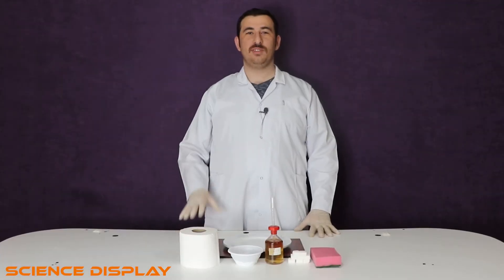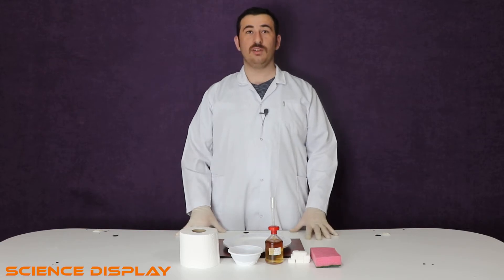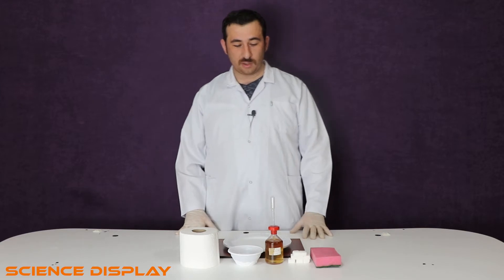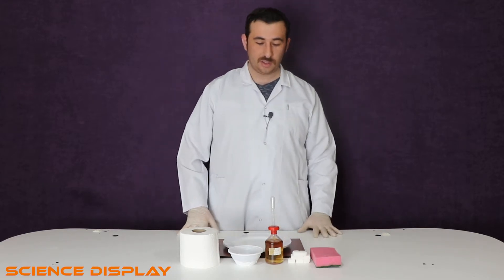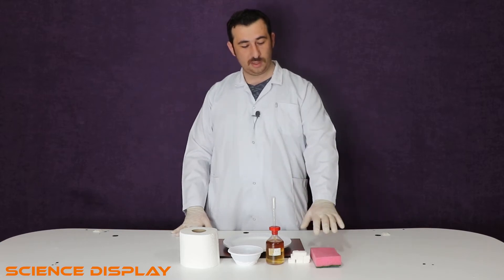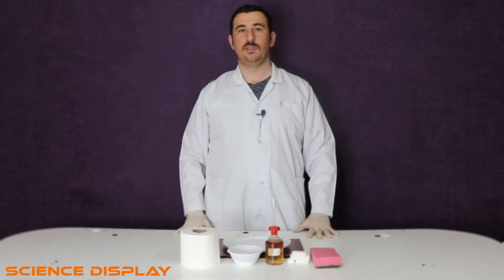Hey guys, welcome to Science Display channel. Today we are going to make an experiment about chemistry and we are going to analyze the reaction with the sulfuric acid and the sugars, the sponge, and the toilet paper.